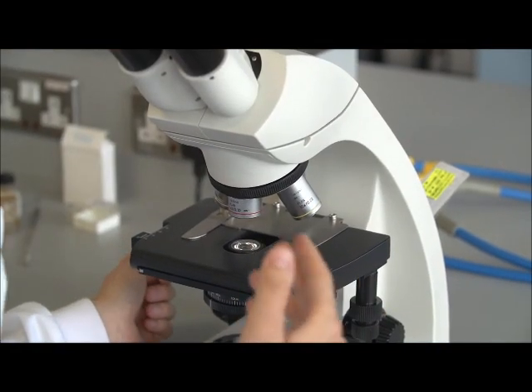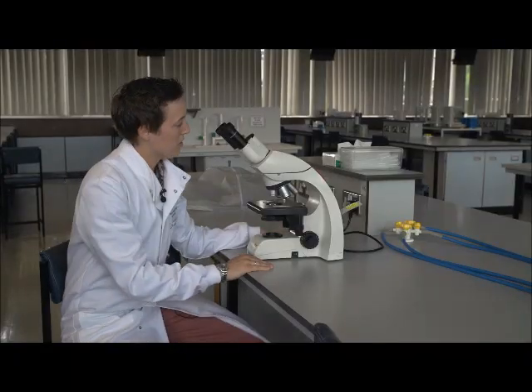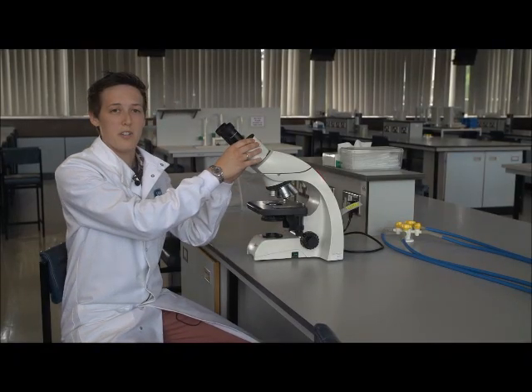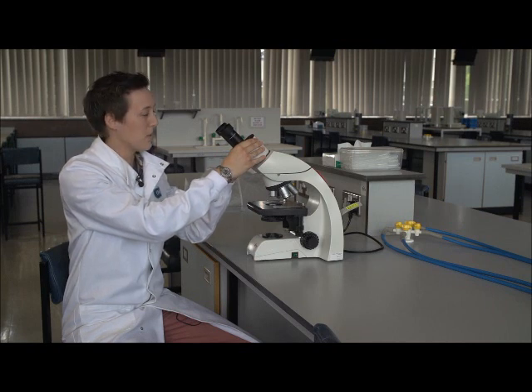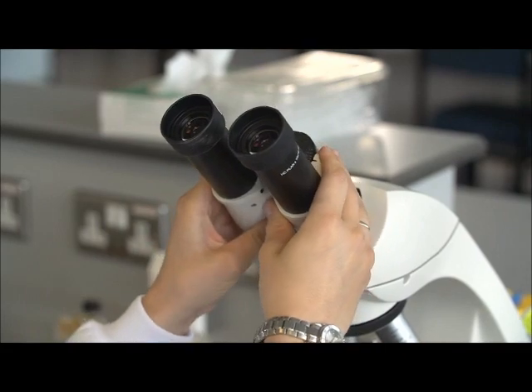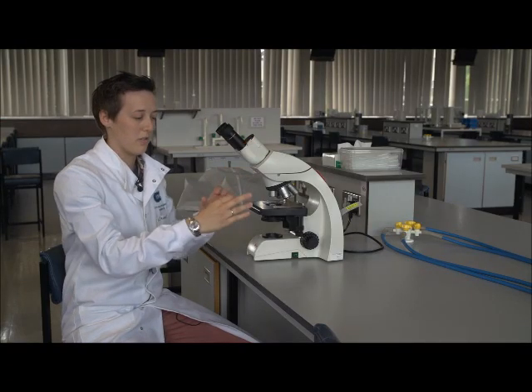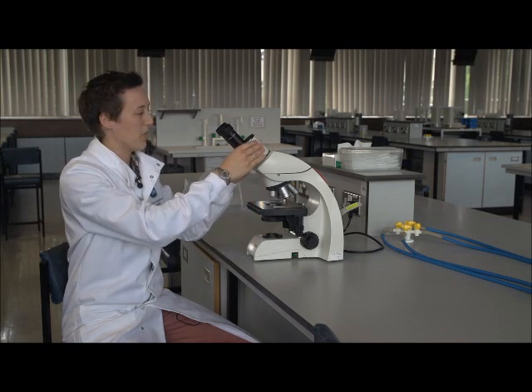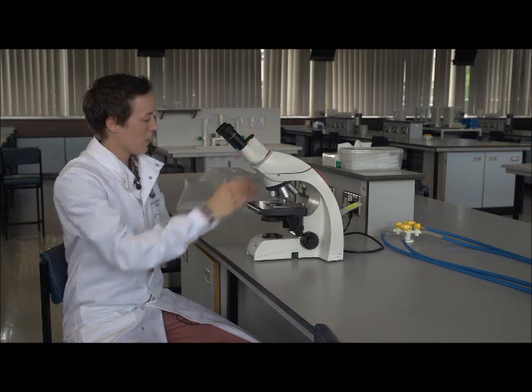So I'll start by going through some of the basic parts of the microscope. Starting at the top, these are the eyepieces. These are the parts that you need to look through to see your specimen, and they're also adjustable. You want to be able to adjust these so that you can look down both of them and see one circular field of view. So adjust these until they suit you.